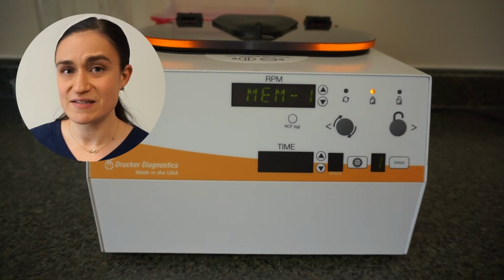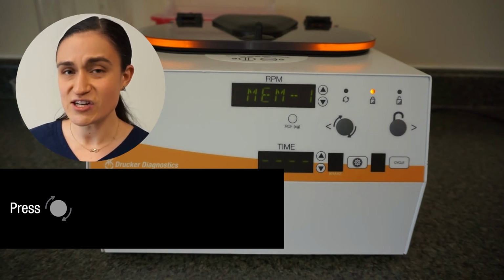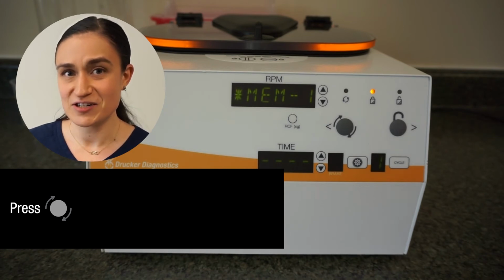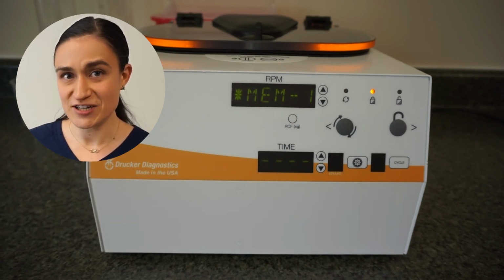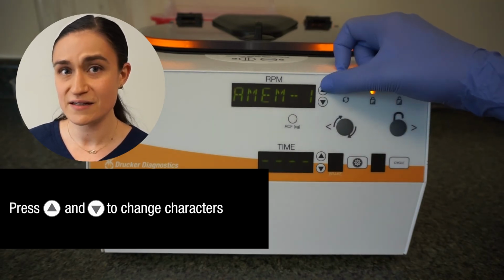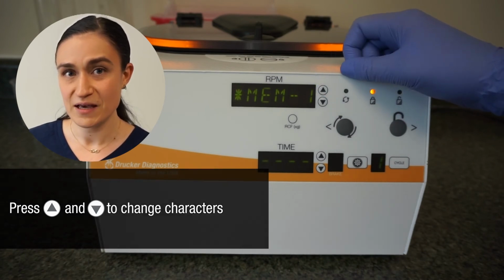Next, we're going to press our Start button. And you'll notice that in this case, the Start button creates a flashing asterisk that wasn't there before on our name. That's going to indicate the character that we're adjusting as we edit the name. Now, that flashing character can be changed by pressing the up and down keys to navigate through the alphabet, numbers, and various special characters that you can use.